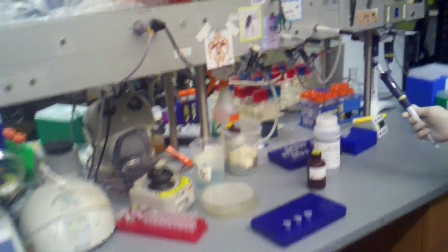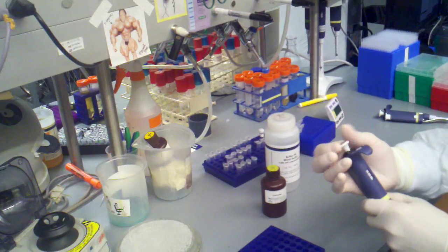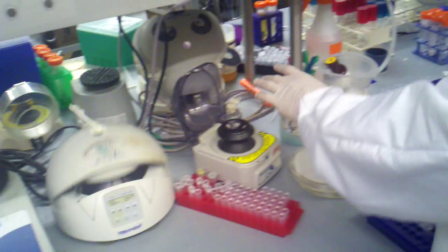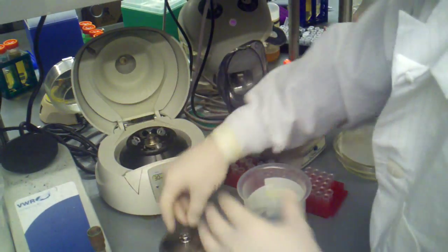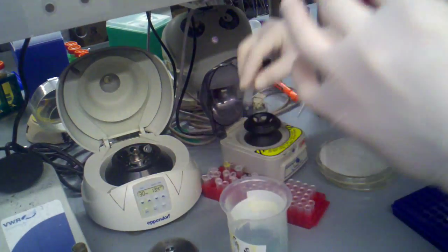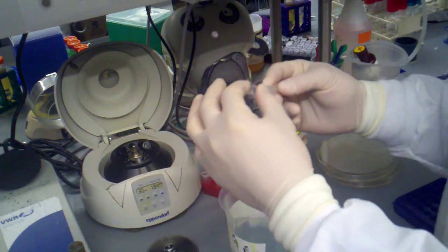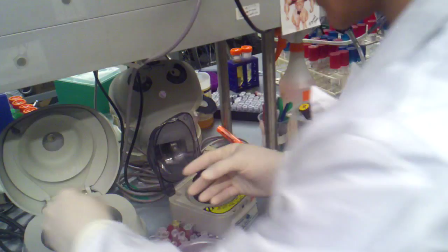So we're almost done here, and I'm going to get my P1000 ready. I'm going to set this to 250 for our two wash steps. This is very similar to a regular PCR cleanup, except that because I was using a larger volume, I actually need to empty the flow-through. You can see that these are very full, and actually, it looks like I might have to do a very quick spin because it didn't empty completely.